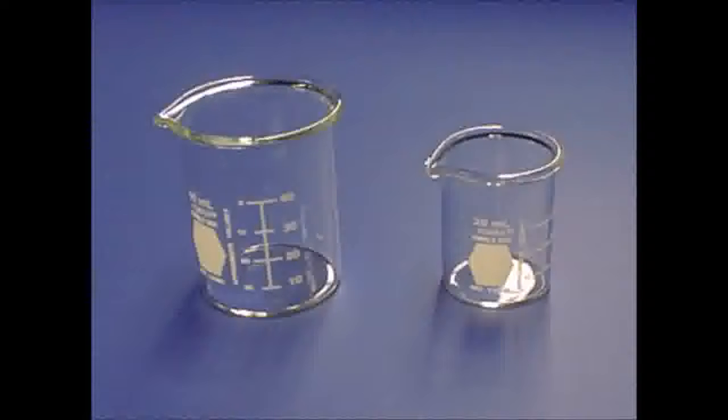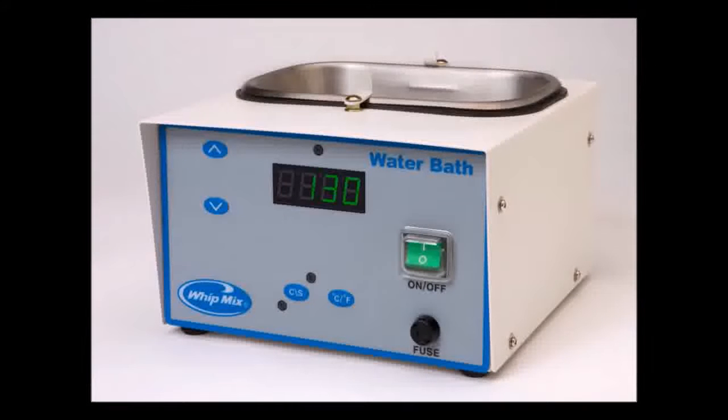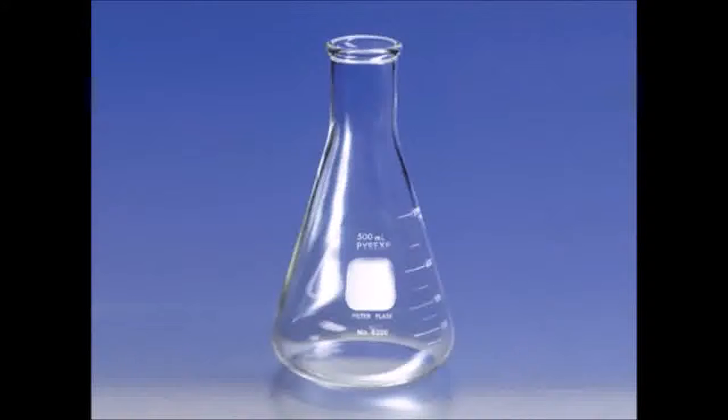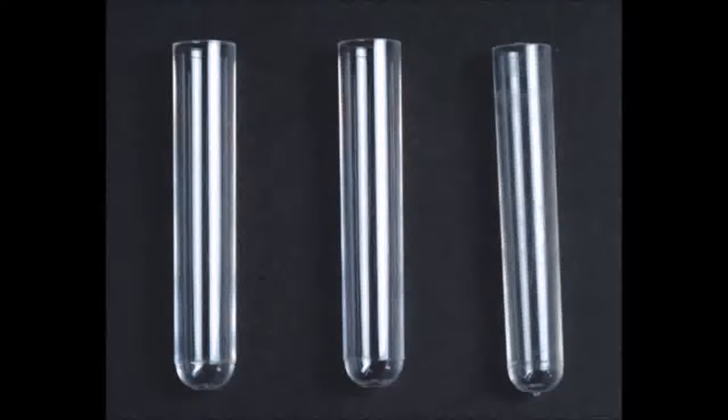Apparatus required: beaker, water bath, conical flask, Hirsch funnel, and test tube. Procedure.